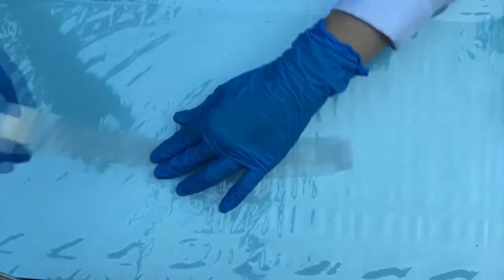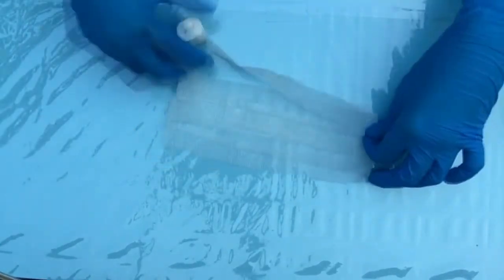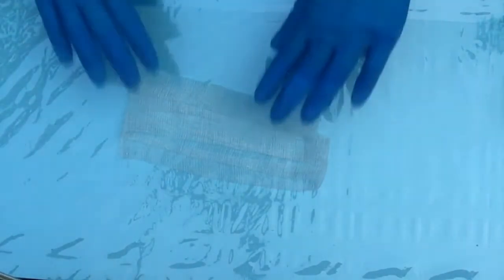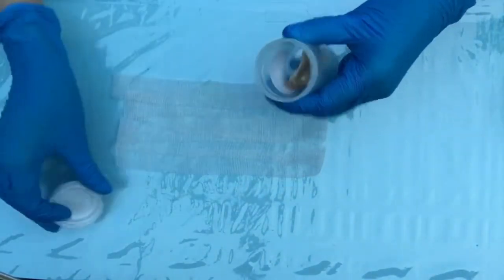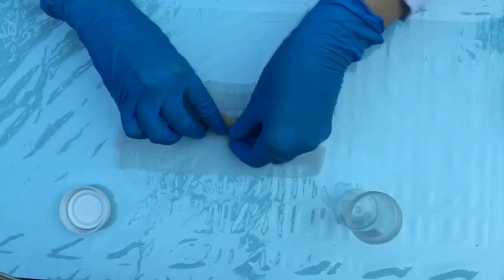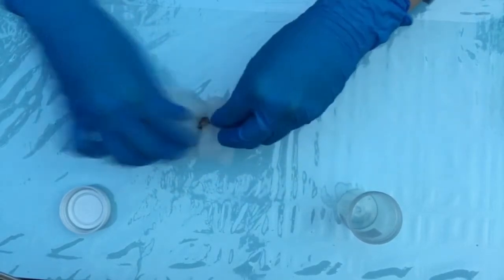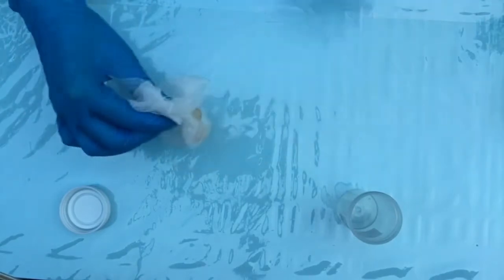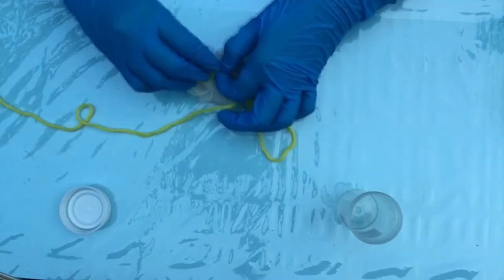First is to make a container for the specimen or the tissue that is needed to be decalcified. After which, we will get the specimen or the tissue needed to be decalcified and transfer it to the prepared gauze. When wrapping the tissue or the specimen, the gauze should be loosely wrapped around it. To secure it, you need to tie it with a string.